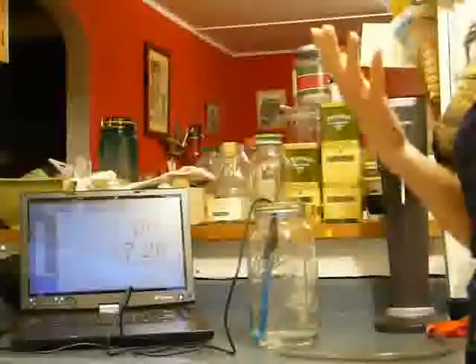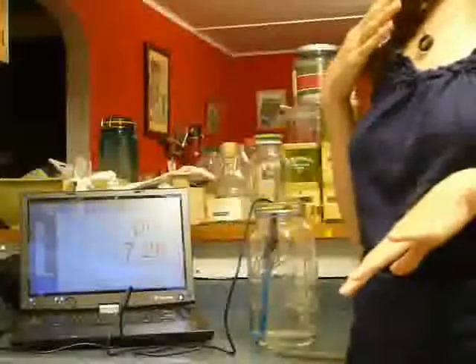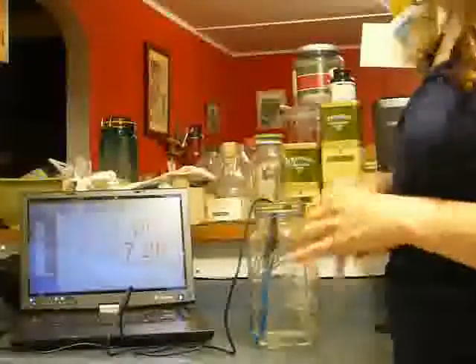Now, you do have to remember that I'm not breathing out 100% highly pressurized CO2 like this machine here. So we may not see as strong a reaction as we did with the compressed CO2, but hopefully we'll be able to see something. So the first thing I need to do is find a way to collect this.